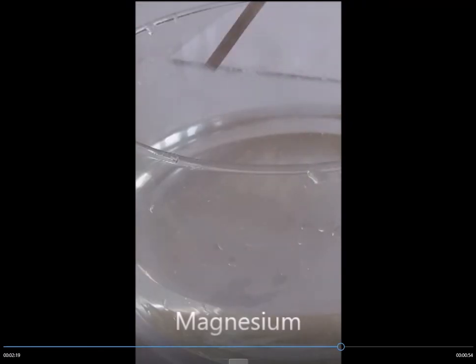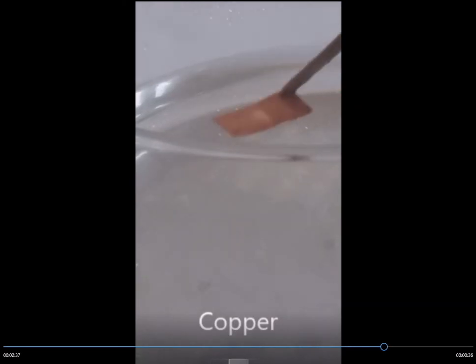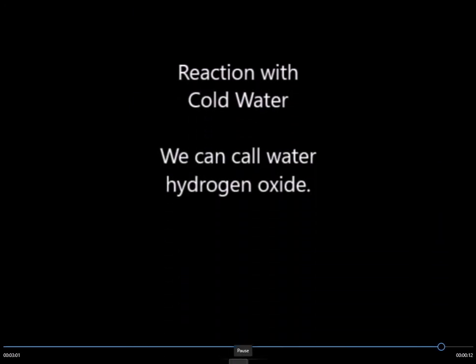A strip of magnesium is dropped into the water. The result is disappointing compared to the others — there are only one or two small bubbles on the surface, practically nothing. Then copper is placed in the water and there is absolutely nothing: no reaction at all. Copper just sinks to the bottom. So magnesium reacted very slightly, but copper had no reaction with cold water whatsoever.